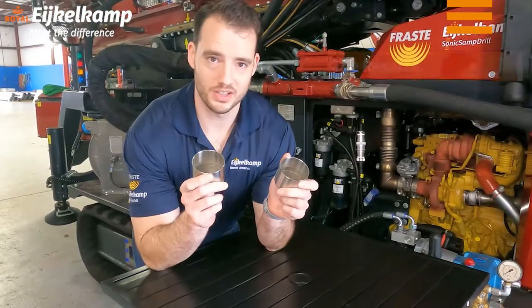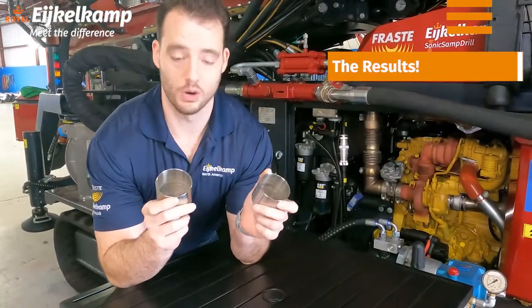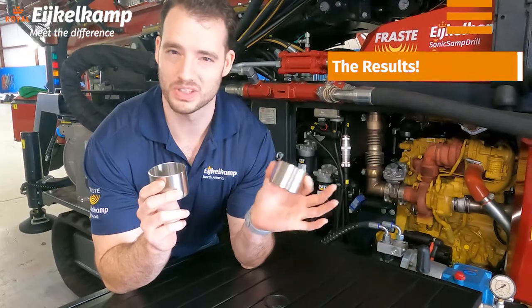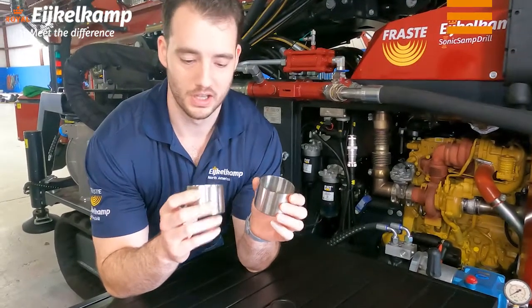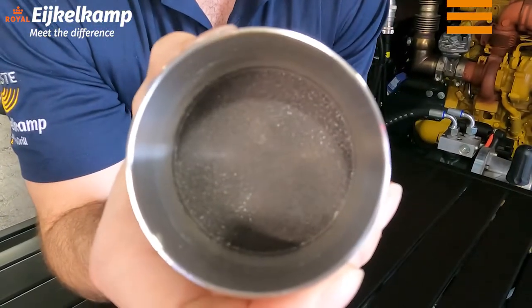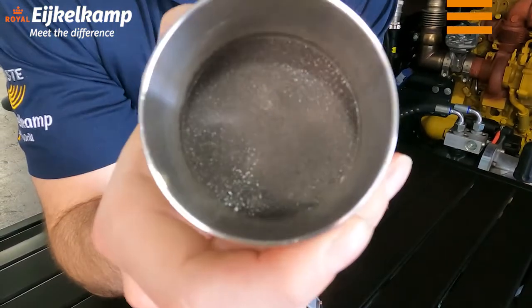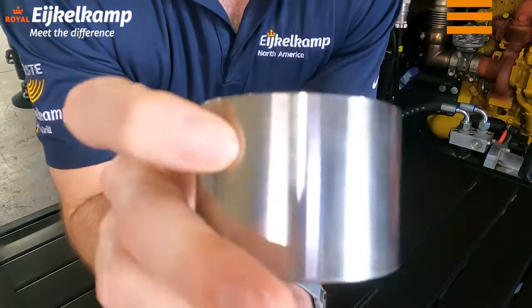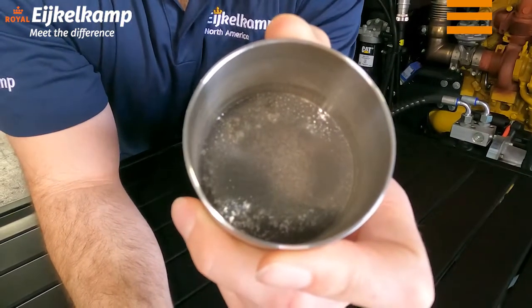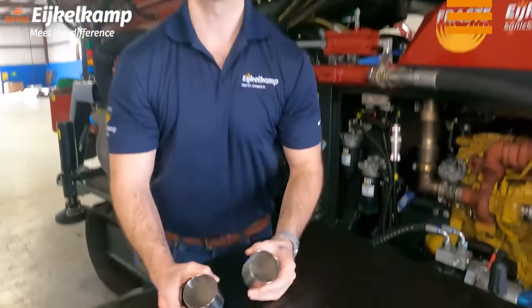We're back the next day with our stainless steel cups dried in the oven at 110 degrees C overnight. We have the first three-minute wash and then the second wash where we ran for about six to eight minutes. Looking at the first three-minute wash, there's a lot of material — you would weigh your cups beforehand, then weigh again to calculate how much dry mass is in there. Looking at the second wash, you can see a lot more of the bottom; there's maybe a third to a fourth as much material. Most of it seemed to come out in that first three minutes. Now you know what your sample is and how it will behave. Running eight replicates lets you average results and get a solid picture.